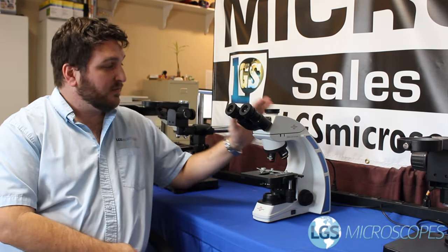Hi, welcome back to LGS Microscopes. My name is Paul and today we're briefly going to go over the proper way to use immersion oil on a clinical microscope.